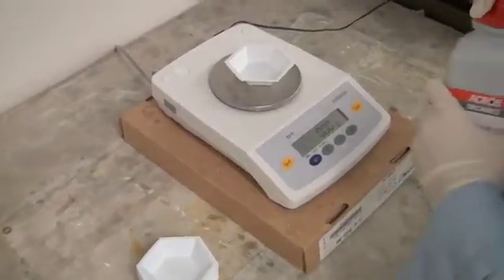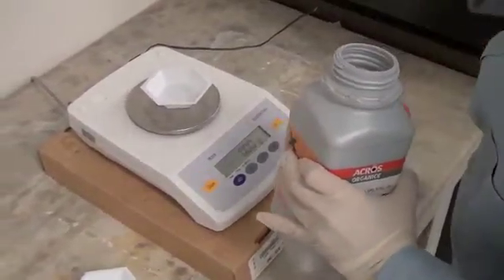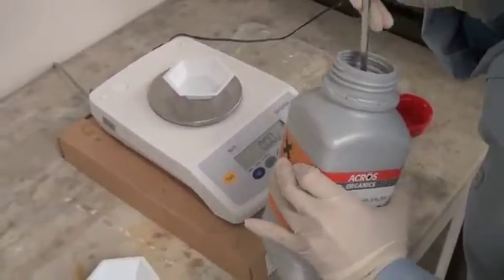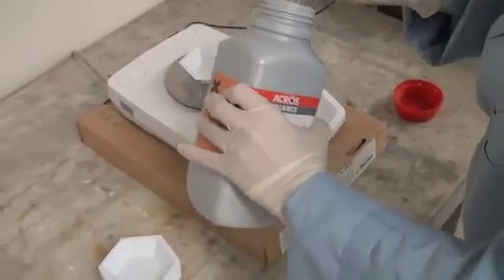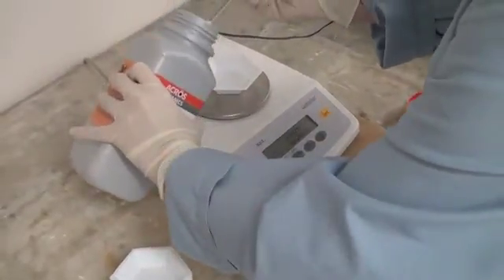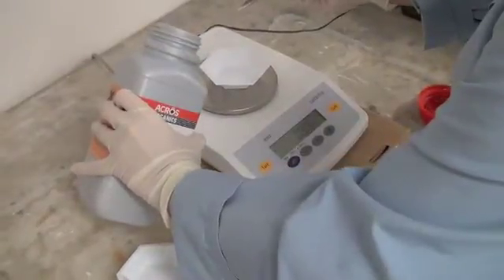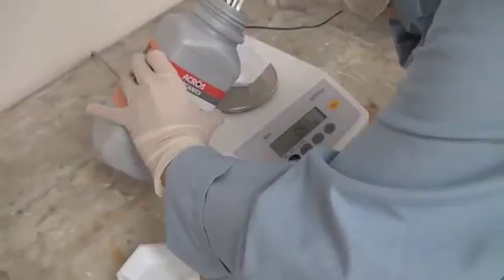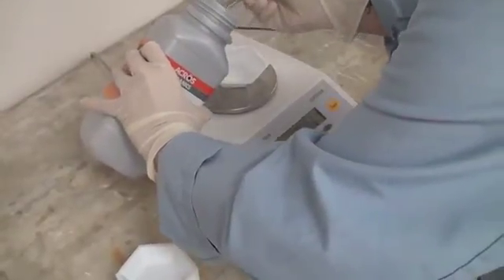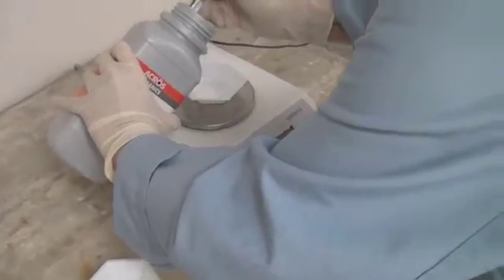Oh, Donji, what's that white powder? Why, that's ammonium sulfate. Even though the assay team has not confirmed that there is an enzymatic activity in the crude, Biochemist Dicer is saving time by measuring out the needed ammonium sulfate for her 40% saturated salting out step. Remember, saturation is not a concentration, but a value relative to how much salt you add to a volume to achieve 100% saturation.